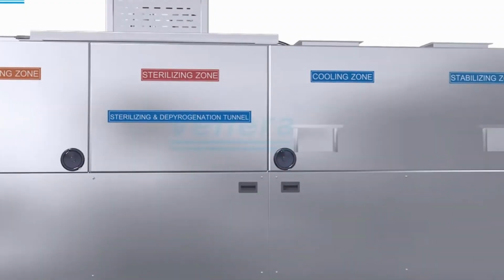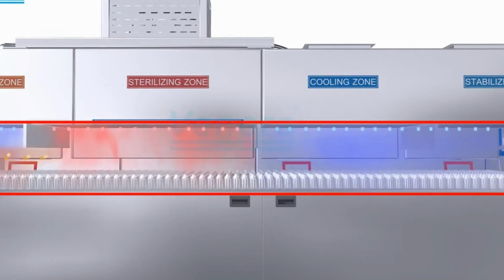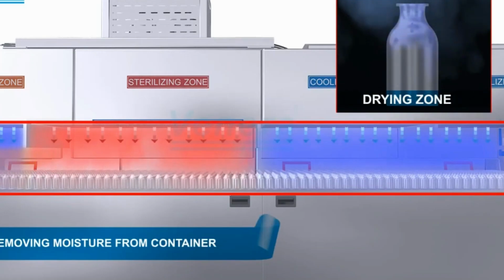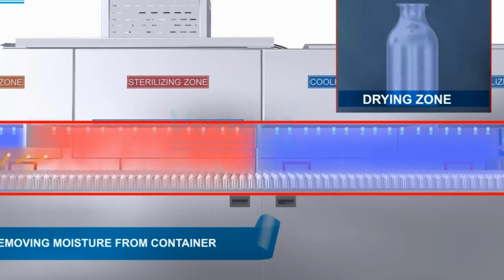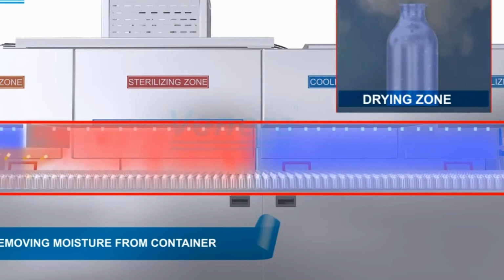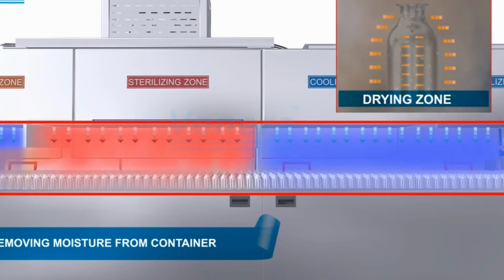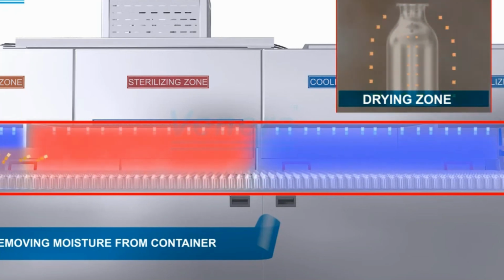Cooling zone. After depyrogenation, the containers move into the cooling zone, where their temperature is gradually reduced. Forced cooling mechanisms are often used, like filtered air, to bring the temperature down to a level suitable for handling, while maintaining a sterile environment. Unloading stage. Once the containers are cooled, they are unloaded from the depyrogenation tunnel and transferred to the next step in the manufacturing process, usually sterile filling under aseptic conditions.